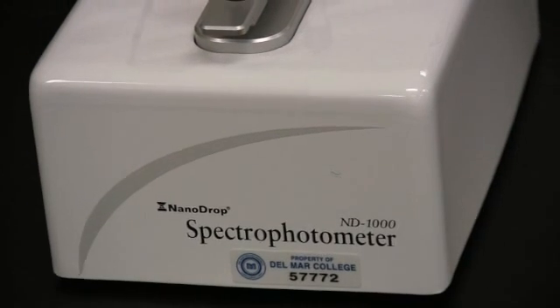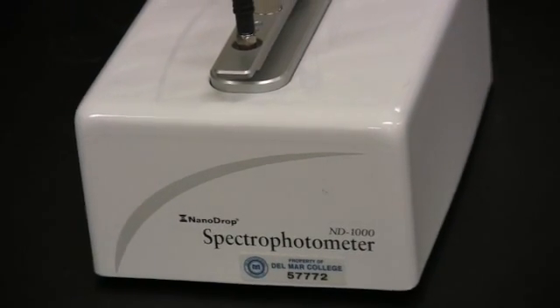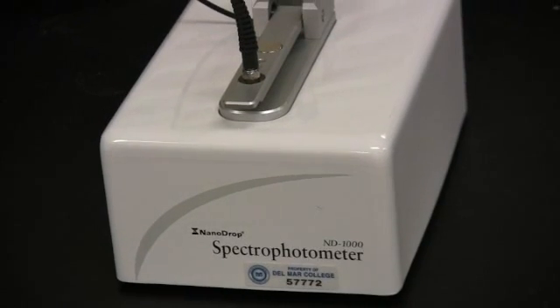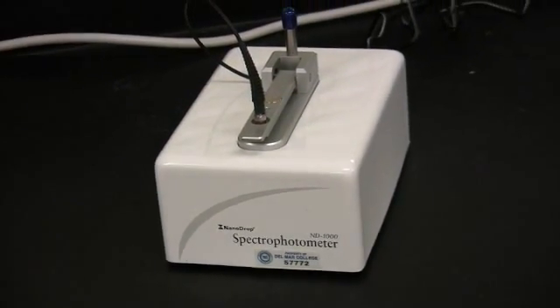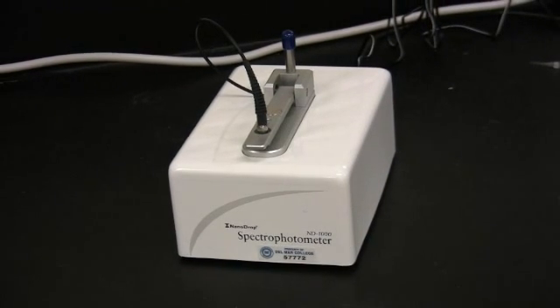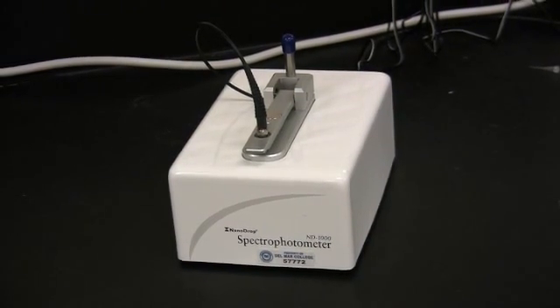In addition, the Nanodrop can also evaluate quality via an analysis of the 260-280 nanometer ratio. The Nanodrop is comparatively simple and quick to use when compared with similar spectrophotometers. The following video will aid in the quantification and quality assessment of a sample of DNA.